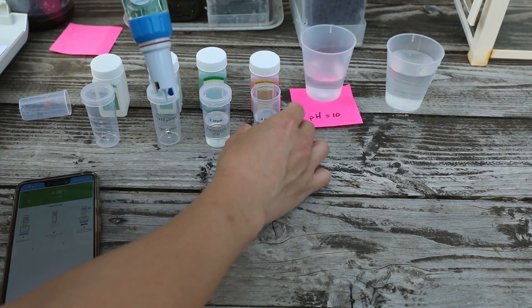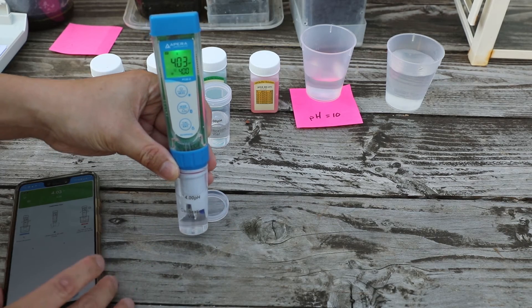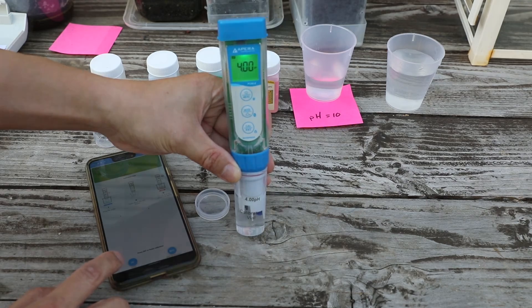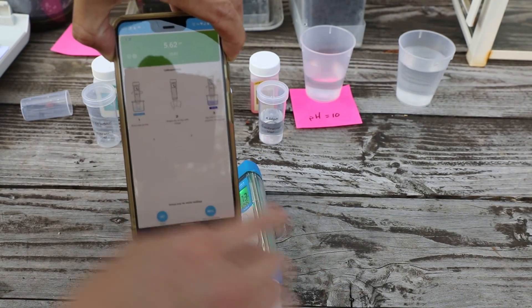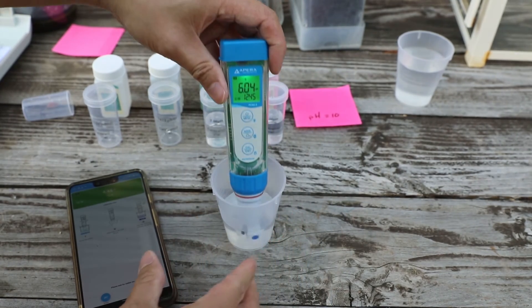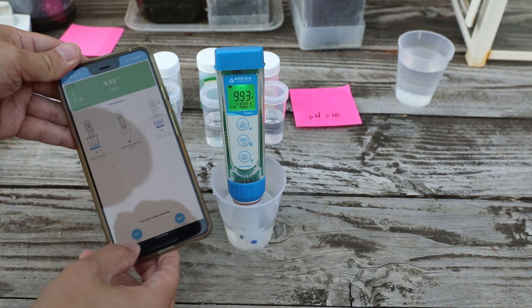I'm grabbing my pH 4 for the next calibration. Give it a good swirl to remove any bubbles. When you feel confident in the numbers, press the enter button. If you have another calibration standard for pH, the more the better. In my case it's the high pH — pH 10 — which I have available. Give it some time to calibrate and stabilize, and when you feel confident, press the enter button.